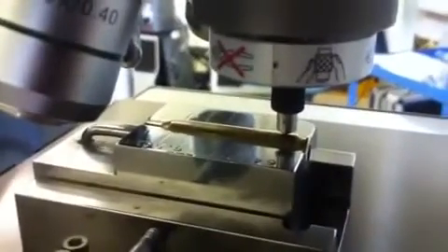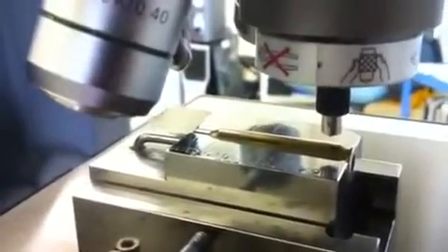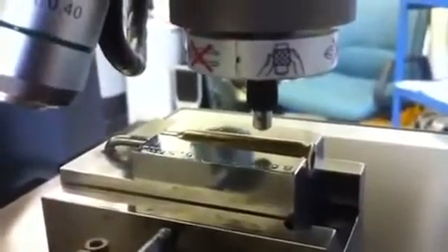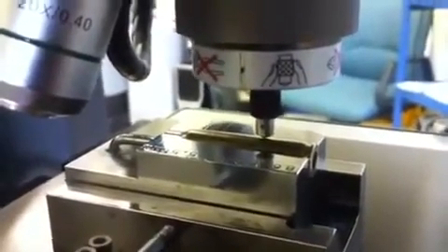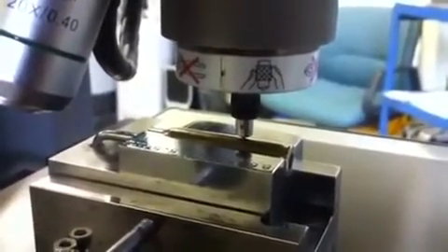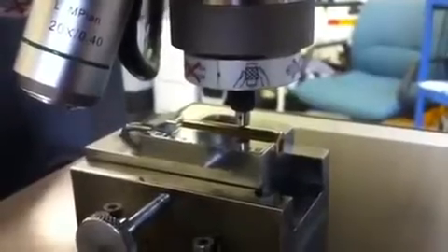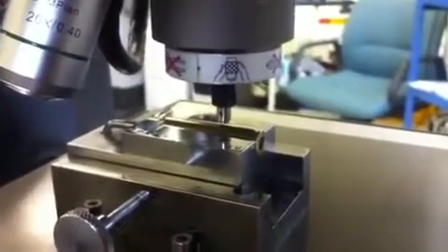What I've programmed in here for this particular application is to do four indentations on the larger OD of the bullet shell, and then a final indentation on the necking end of the shell. The system is now quickly moving over to each location. I've set the dwell time to comply with the ASTM and ISO standards, so it's set to 10 seconds. The dwell time is variable though — we can change it to whatever the user may desire.